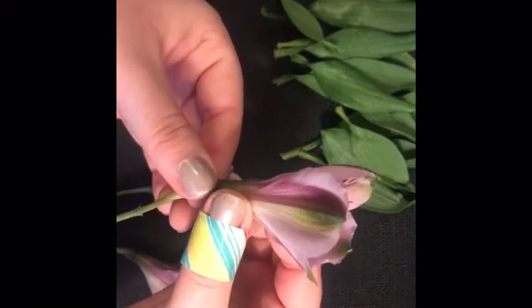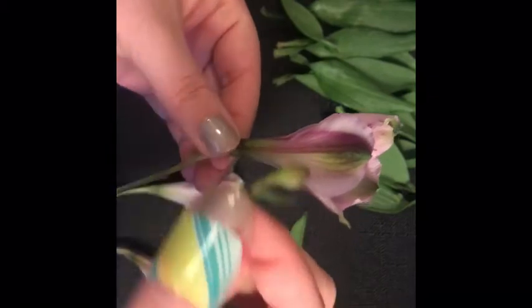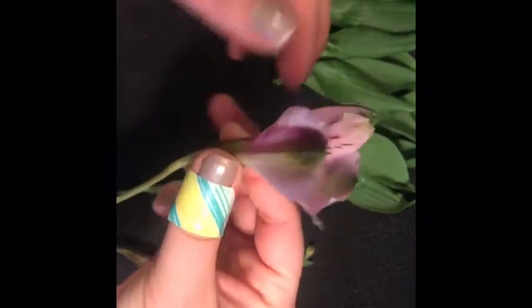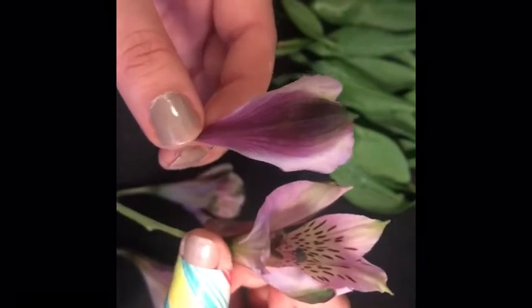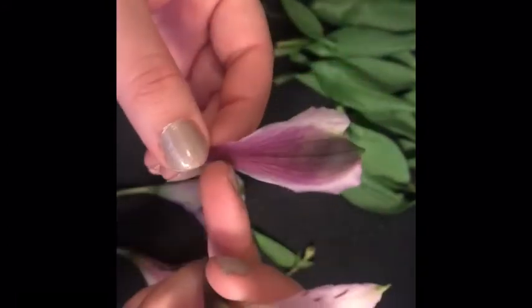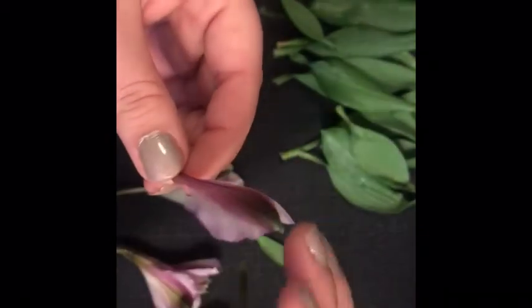So if you kind of do that, you can see how they're protecting. So those sepals continue to grow and protect the petals as the plant matures. So we're going to take off those sepals, and I just think they're really beautiful, and you can tell that they're different from the petals on this flower because they don't have the speckles. They're very solid, and they have that really nice tip, and you can see where it curved over before it bloomed. So we're going to take our sepal pieces off to the side.